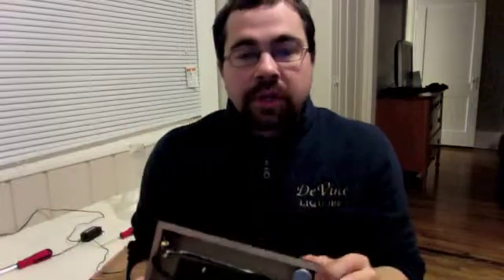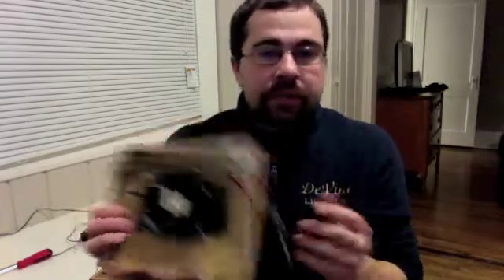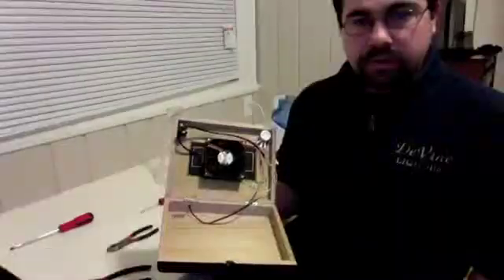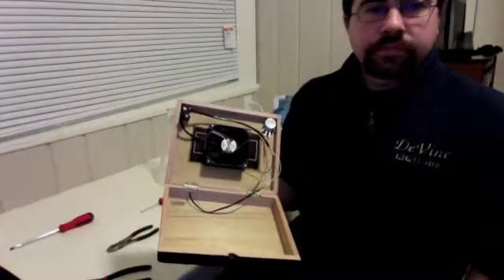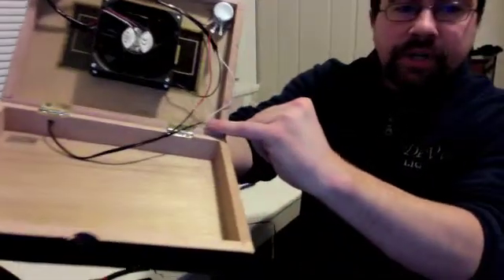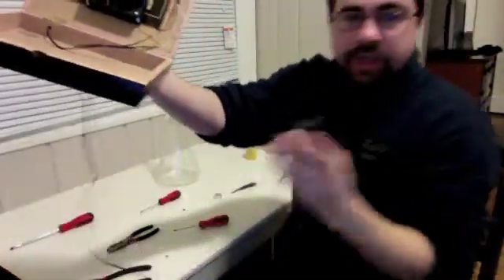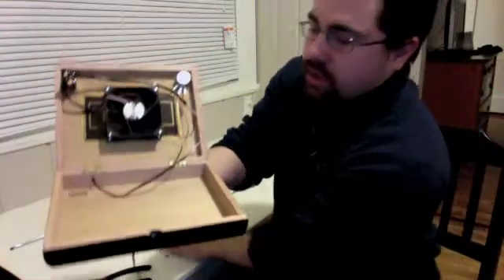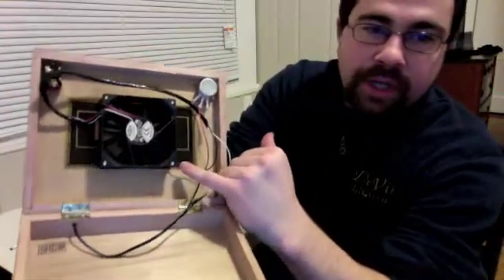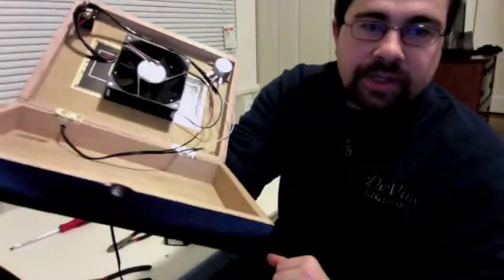Fortunately, they use so little energy that it's not even really a concern, but you might as well. It's there. Alright, so this is what we end up having. As you can see, I got these 2 wires down here, wired up to the charger that comes out the back, and the black wire I have hooked right up to that screw, and that's the ground.